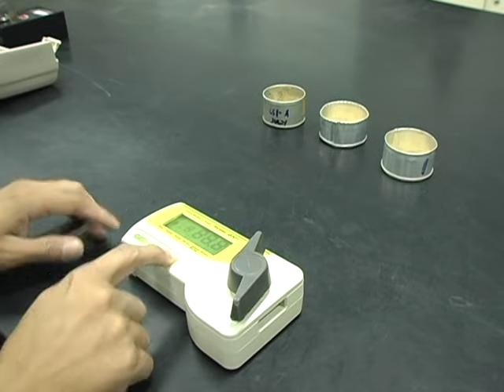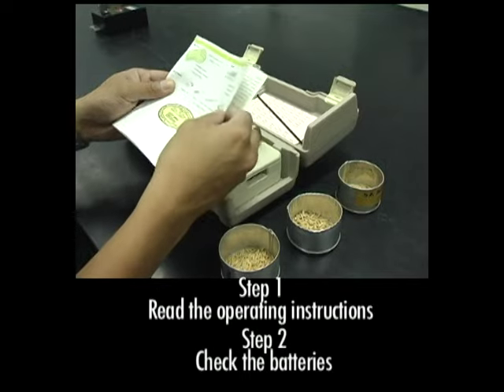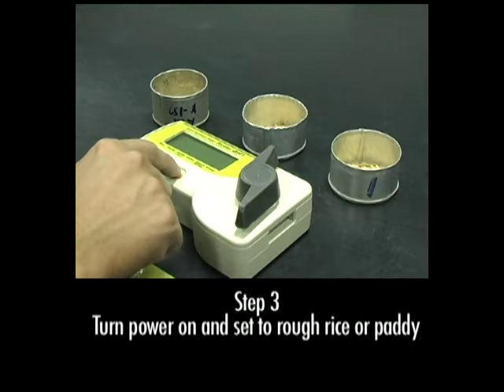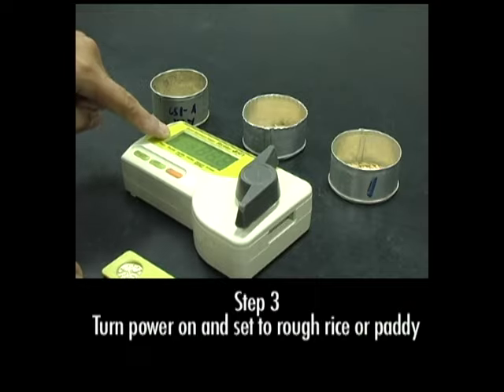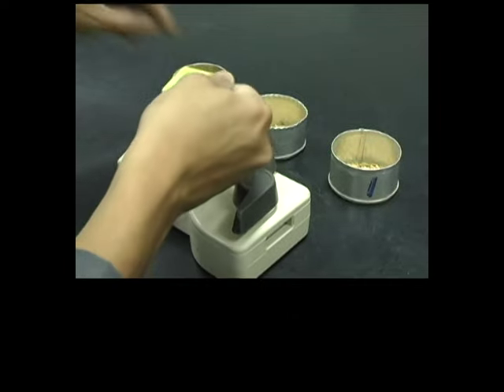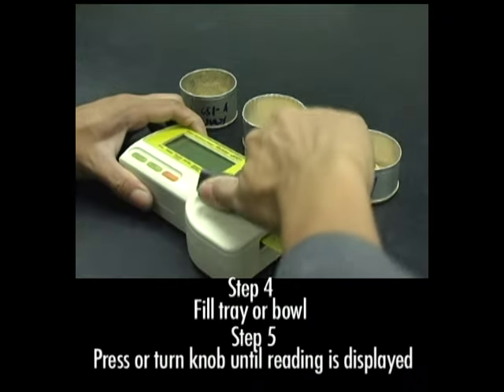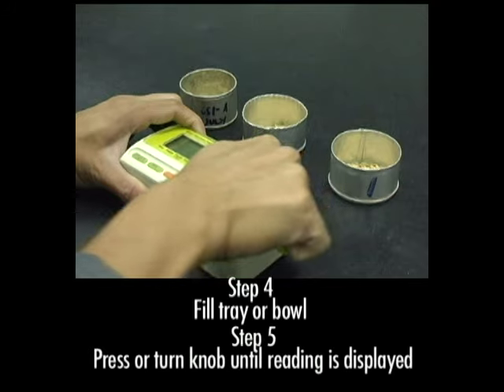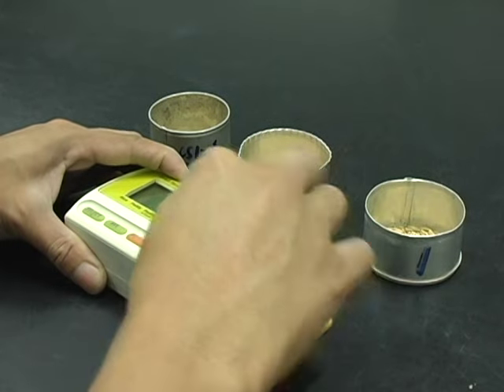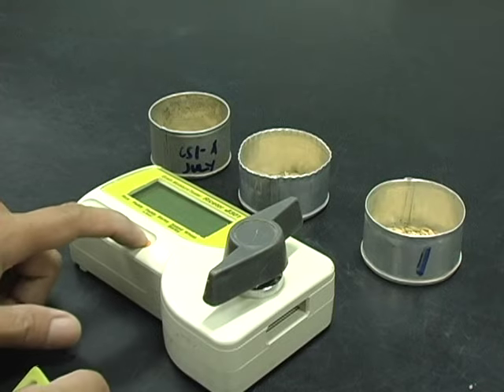Let's review those steps again. Read your operating instructions and check that the batteries are good. Turn on the machine and set it for rough rice or paddy. Fill the tray or bowl with a paddy sample and turn the knob all the way until a reading is displayed. Then follow the steps again, testing 3 or more samples.